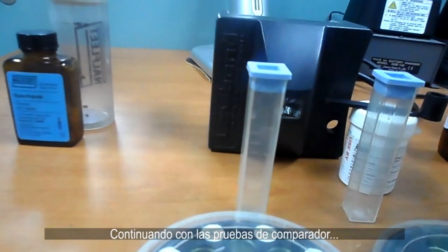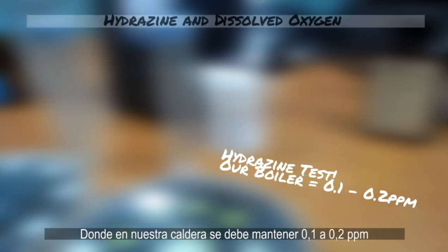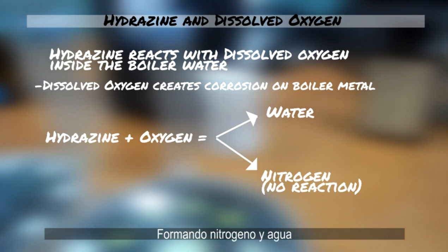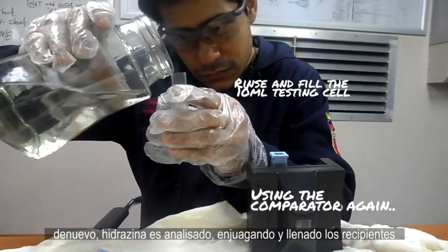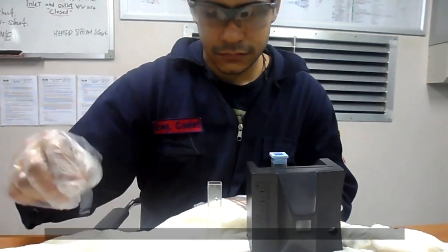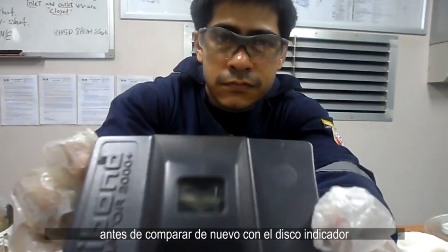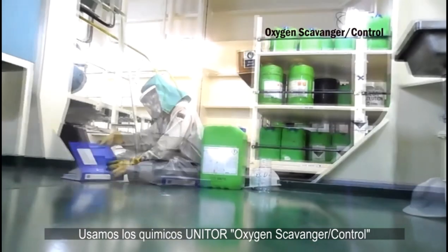Continuing with the comparator, we now test hydrazine levels. In our boiler, hydrazine should be at a concentration of 0.1 to 0.2 parts per million. Hydrazine is very important because it reacts with dissolved oxygen inside the boiler water to form nitrogen and water. To test it, rinse and fill the cells with 10 milliliters of sample water, add one gram of hydrazine reagent to the right cell, allow it to dissolve, and wait two minutes before comparing colors with the indicator disc.